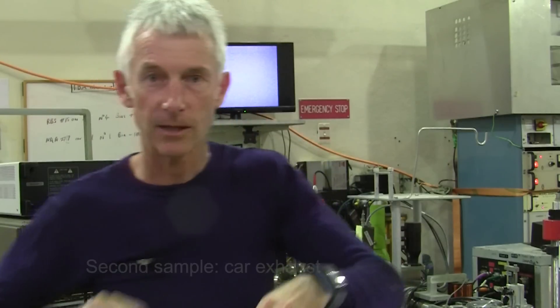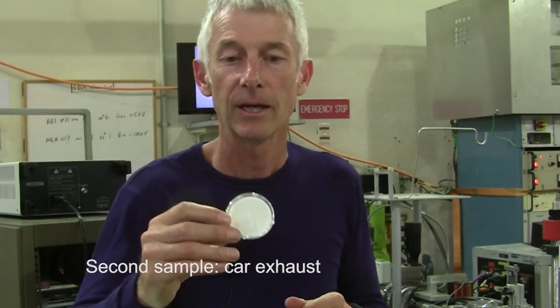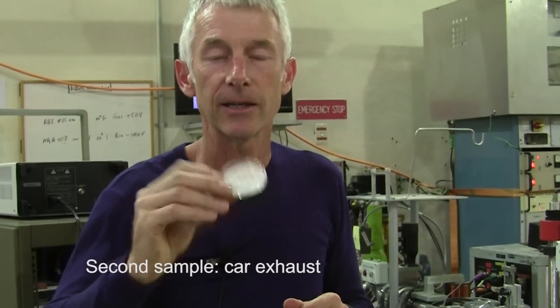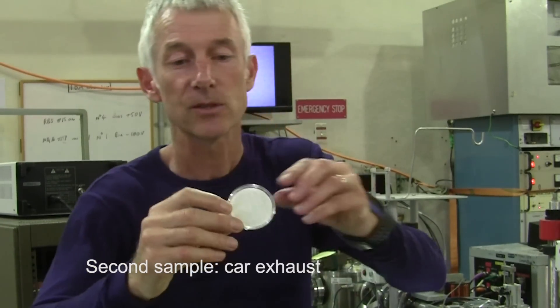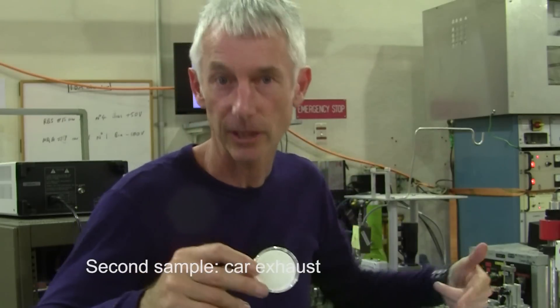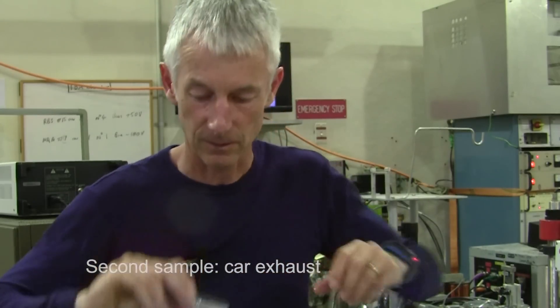The second one collected was from the exhaust of the motor vehicle, and again while this — you can see it's a little bit grey — still has some smoke air pollution on it, with some of the other elements like sulphur that we can detect with our machine.